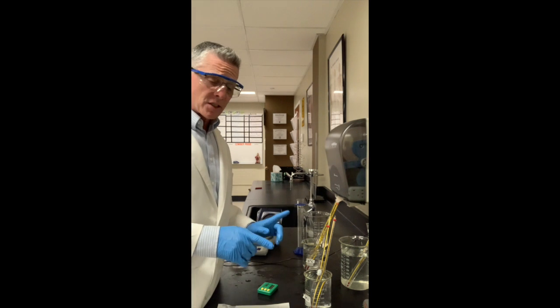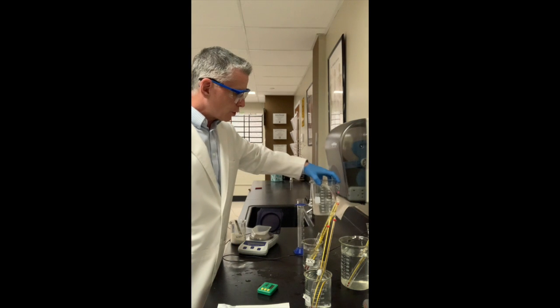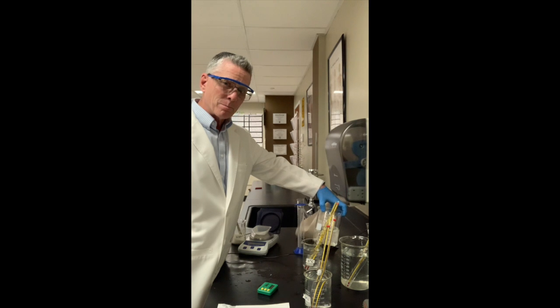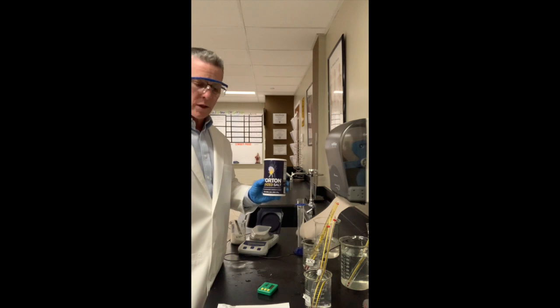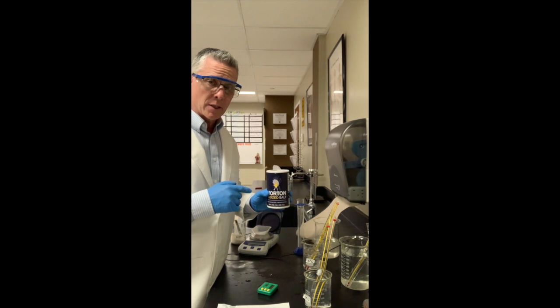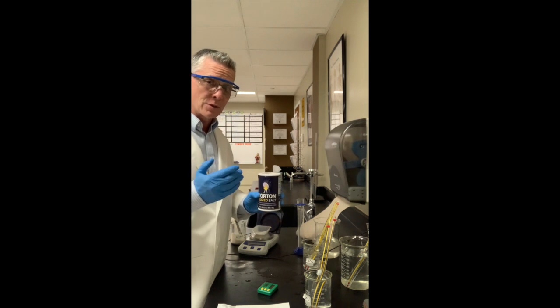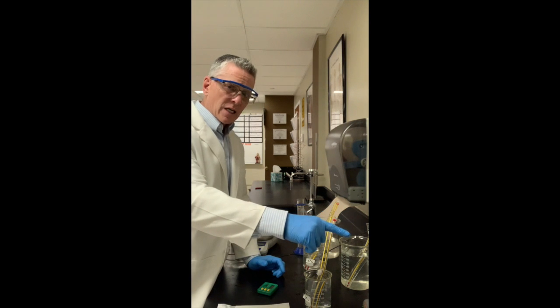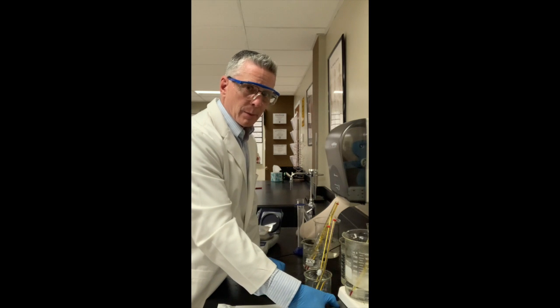Just in case you were wondering, in order to get these temperatures just right, I have used an ice bath that I had to lower the temperature of with salt. That is called a colligative property, when you add a chemical to a substance to raise or lower the temperature. But I could only get it down to 3 degrees. In order to get the hot water, I've got a hot plate right here that I am heating up the water bath with.